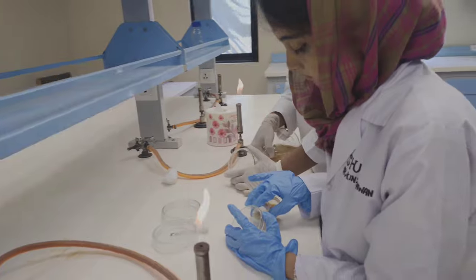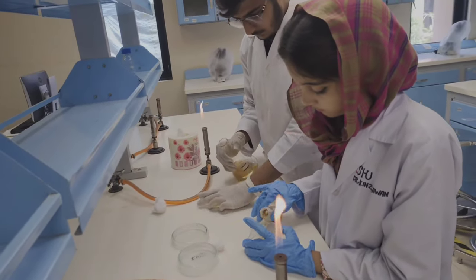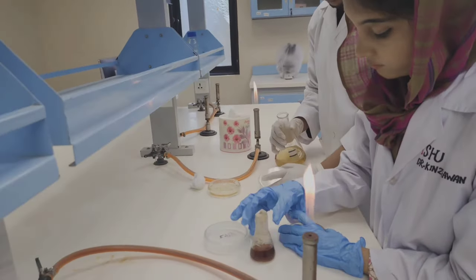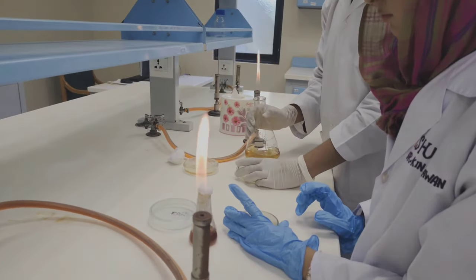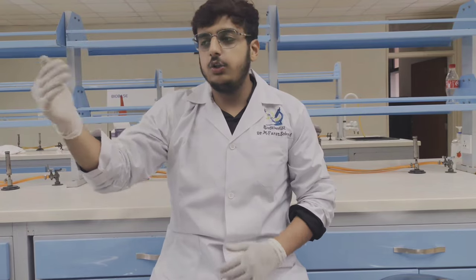Now our step is to inoculate media in plates. As you can see, we will inoculate and prepare dilutions in plates.